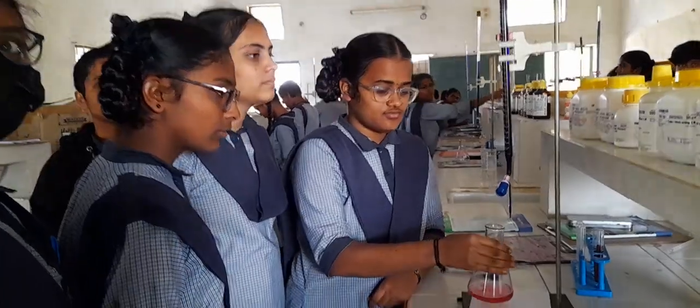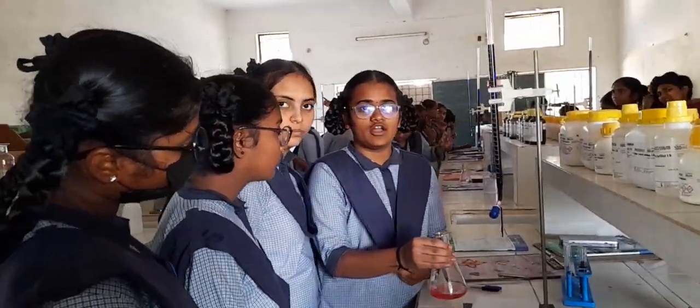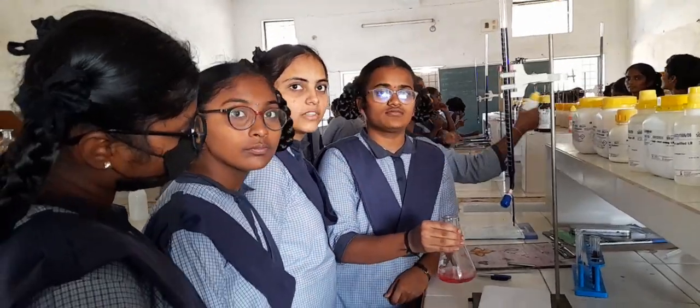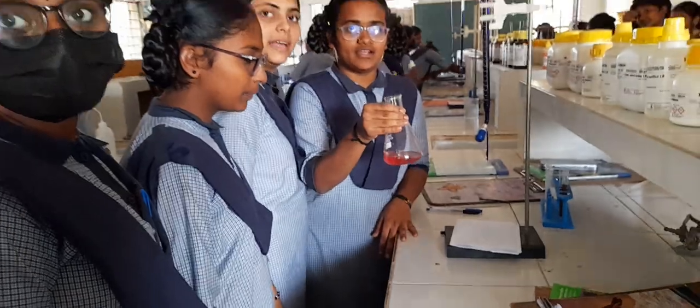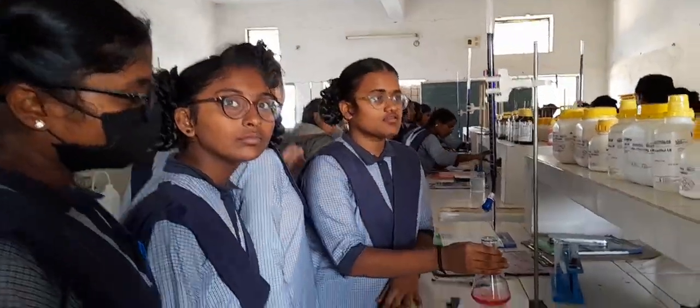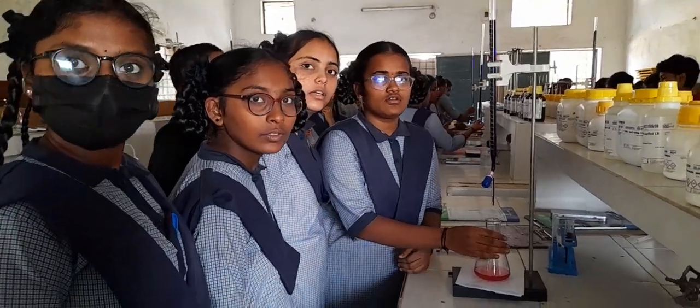What was the initial color of that solution? Initial color pale yellow, ma'am. Pale yellow or a very light shade, yes. So after titrating you have got pink color. Okay. Is this your first reading? Yes, ma'am. So go with 2 more consecutive readings. Then we will go with our calculation part.